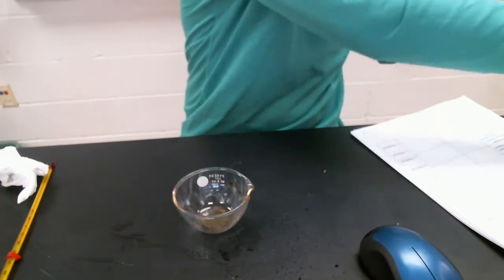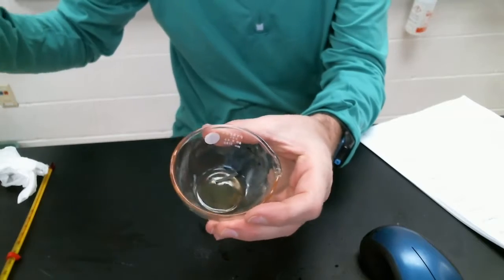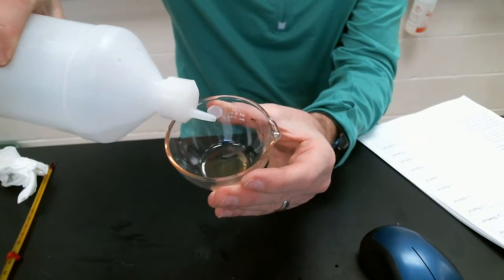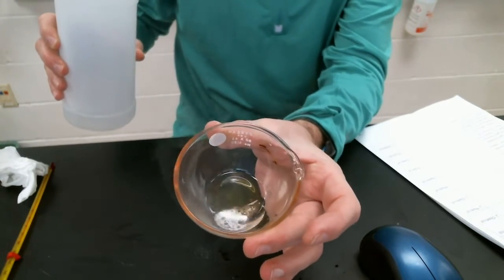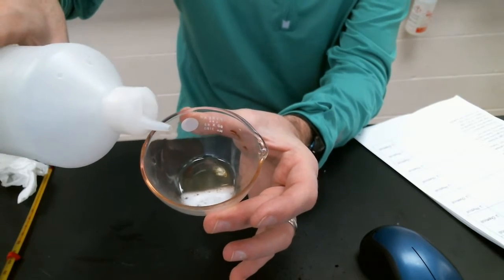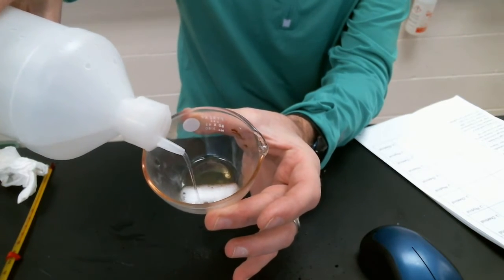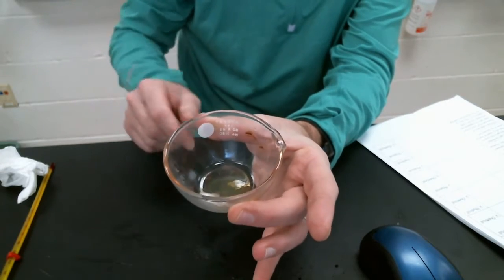And then what I need to do is add some acid. You definitely want to make sure you can observe this pretty well. More hydrochloric acid to our magnesium. Bubbling, fizzing. You can see the gas being produced actually. Ooh, bit of a smell to it as well. The gas being produced has a little noxious smell.